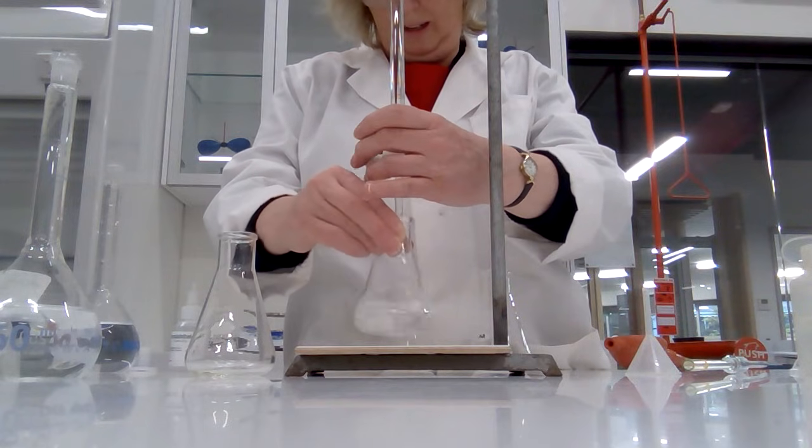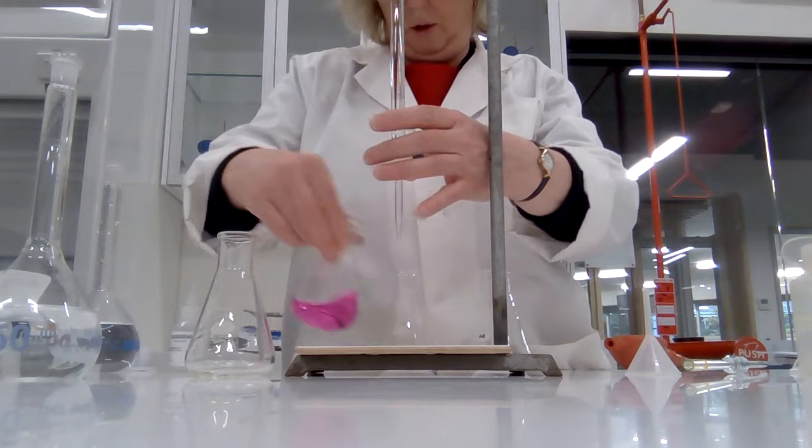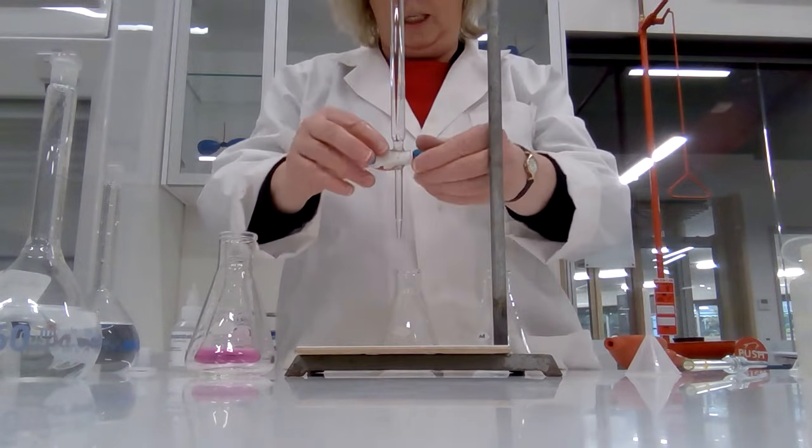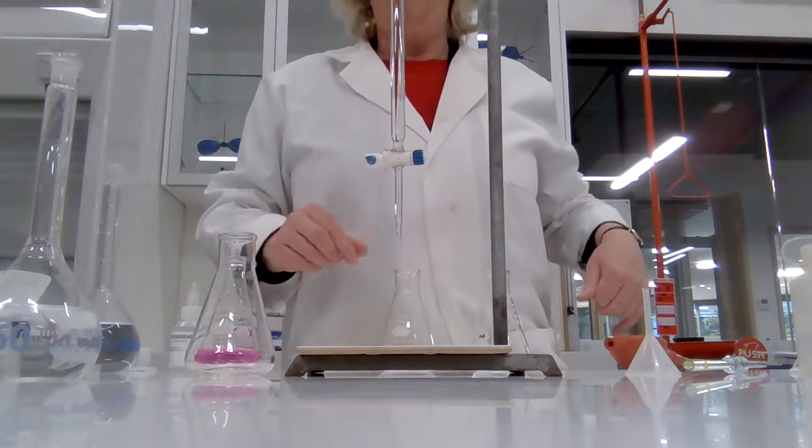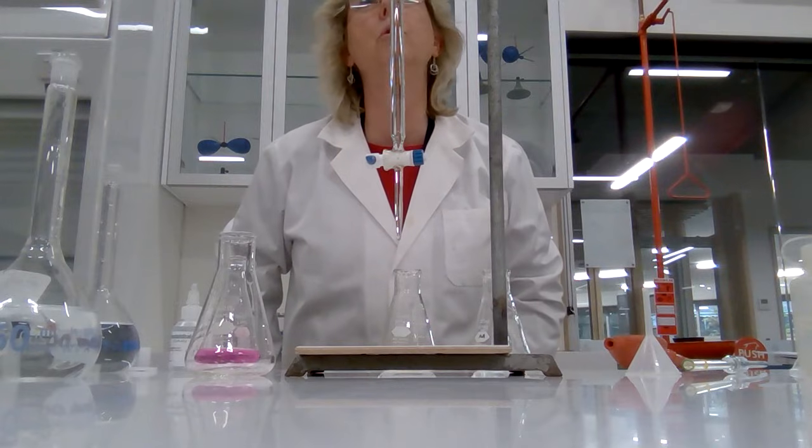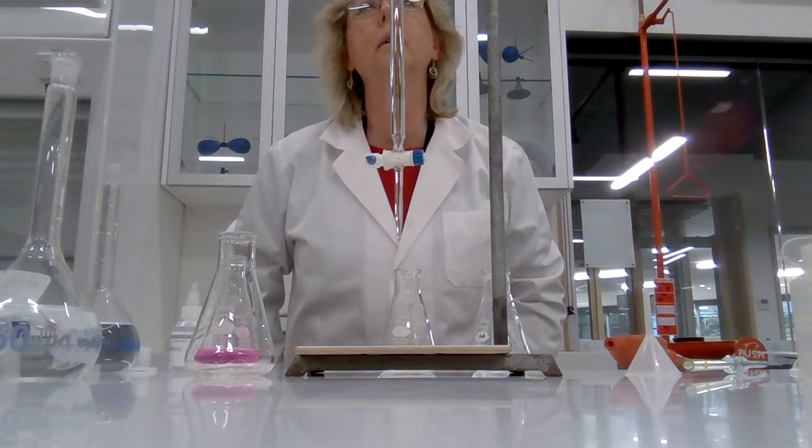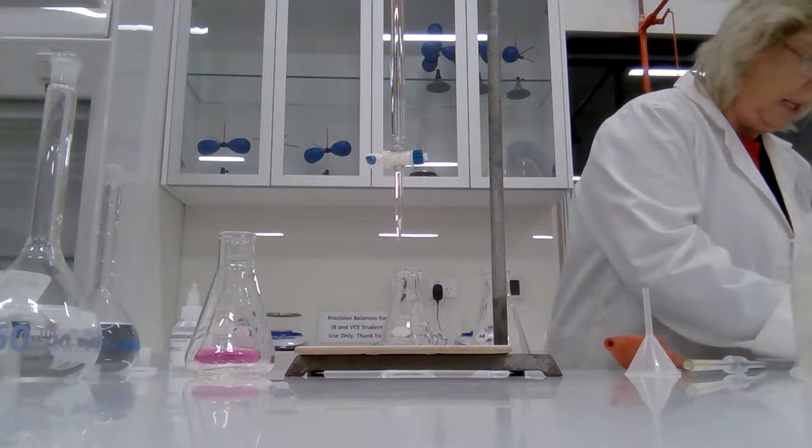No, not quite. A couple more drops. There we go, right, it's done. Good. Oh dear, let's tighten that up and maybe it won't leak anymore. Okay, final volume is 22.70.